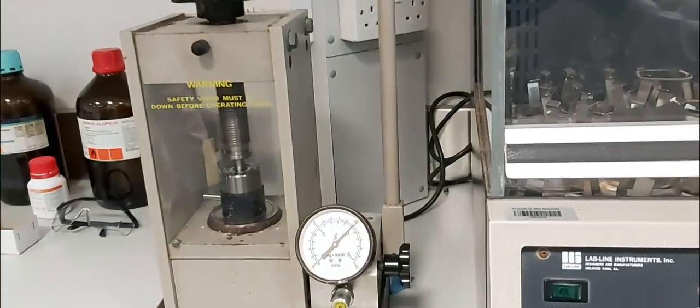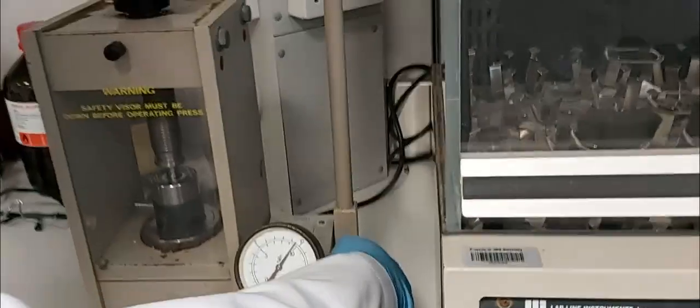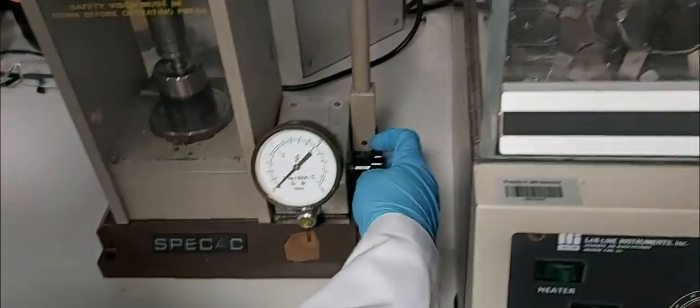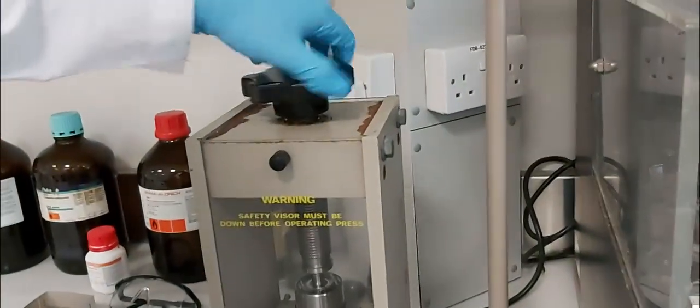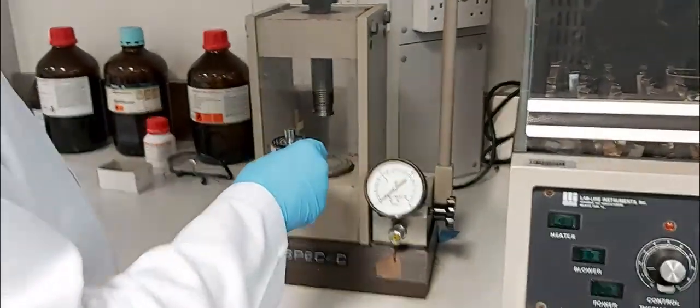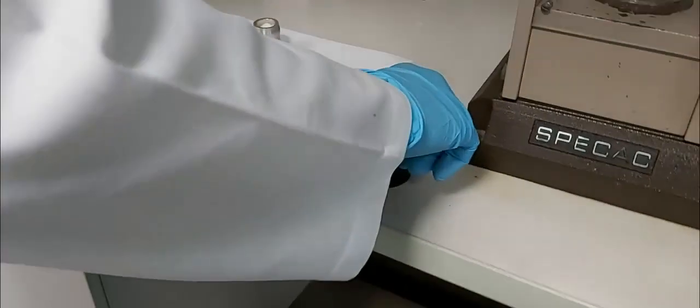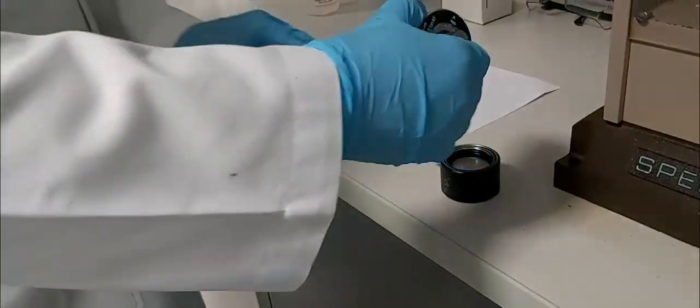We wait around one to two minutes, then we open the press. The powder has been converted to a small pellet — a small disk. Now we have to remove the disk.